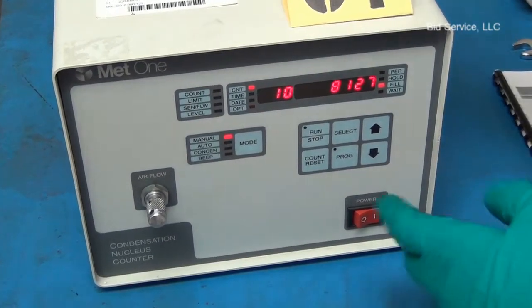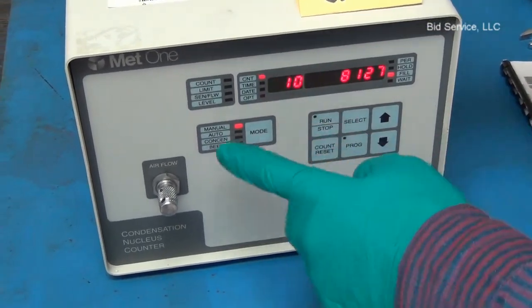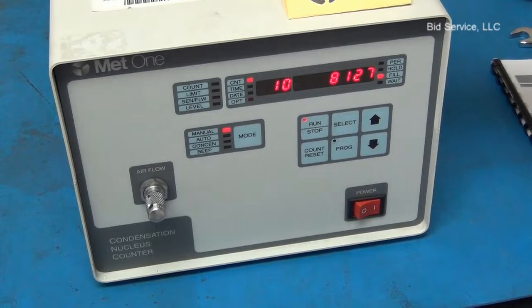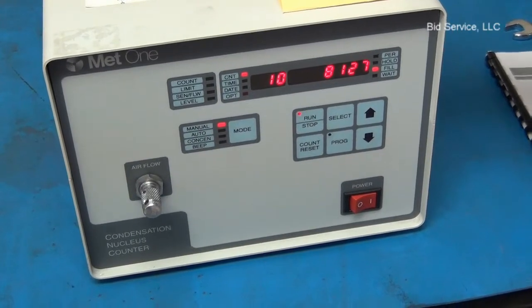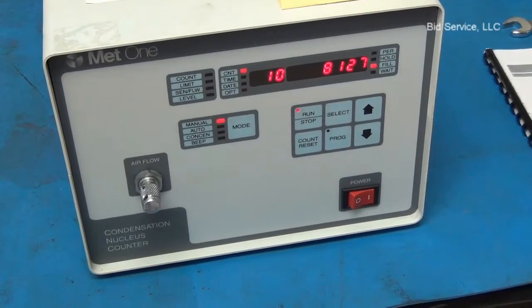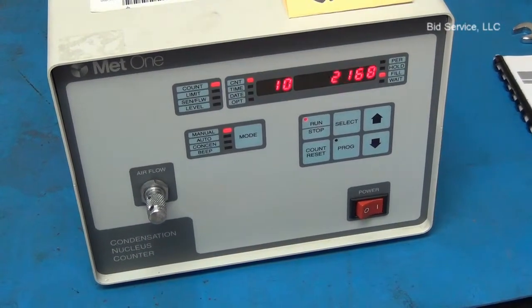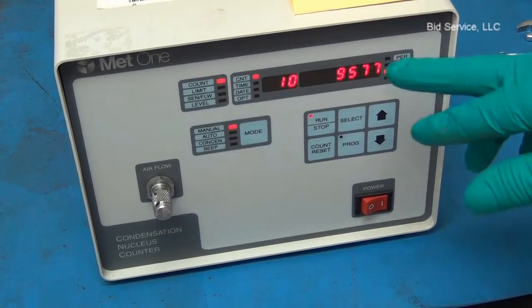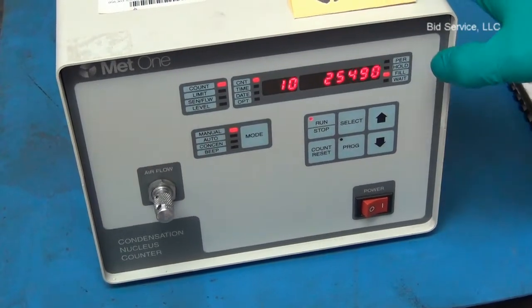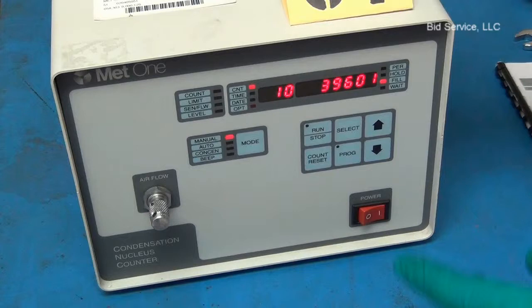The operation is very simple. In manual mode, just select manual mode and press run. The count will start after a time delay, and it will count for 5 seconds and display the result.